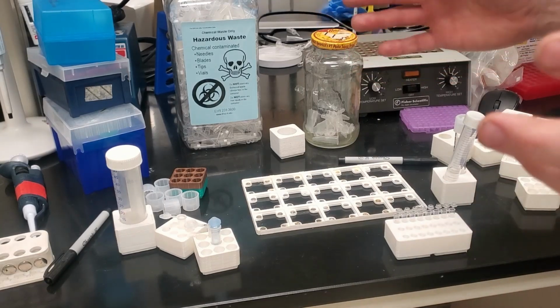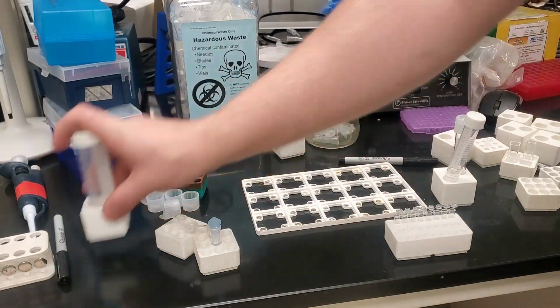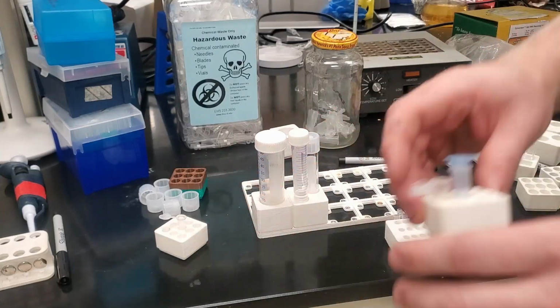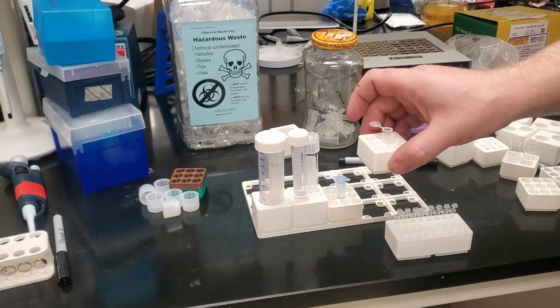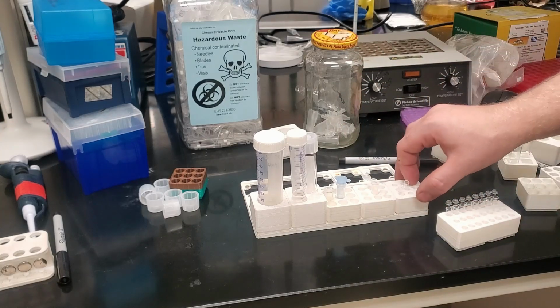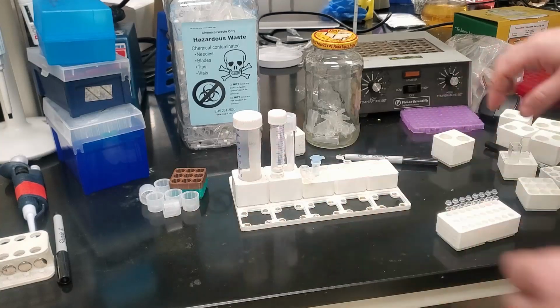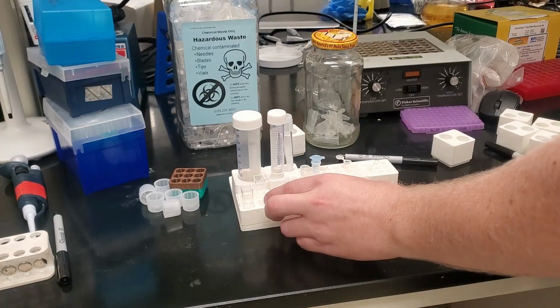Let me show you all the pieces that we've made, and you let me know if you think that this is a world record for most different tubes in one tube rack. We have 50 ml tube. We have 15 ml tube and test tube. We have 1.5 ml microcentrifuge tube and filter tube. We have 600 microliter microcentrifuge tube. We have PCR tube. We have cuvettes. And we have strips of PCR tubes.